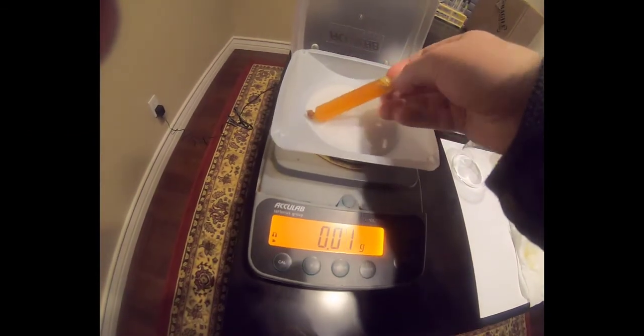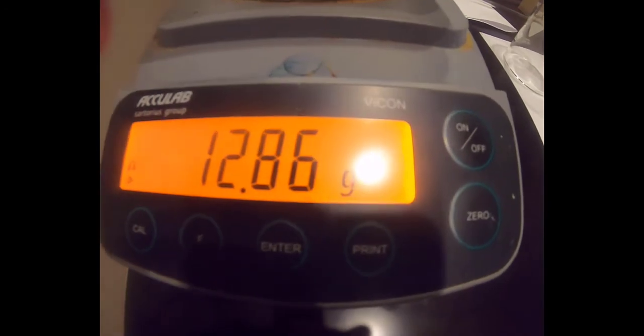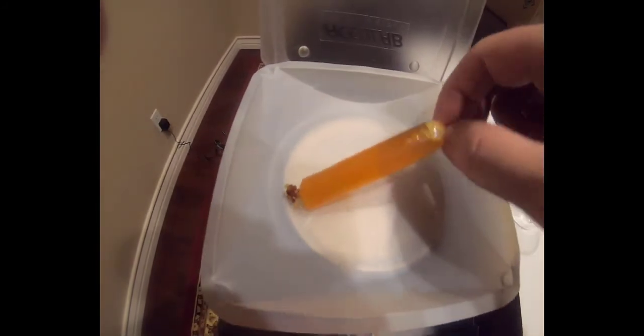I then thoroughly pat dry the experimental bag and then weigh the bag. You should record the final weight of the experimental bag in table 1 on page 3 of your lab handout as 12.86 grams. You should also note the color of the bag in this table. I then place the experimental bag into its own small beaker and I pour the bag contents into the beaker for easier access to the bag solution.